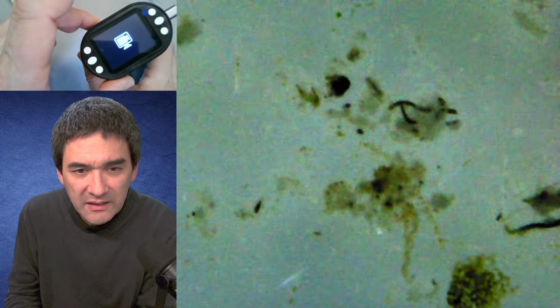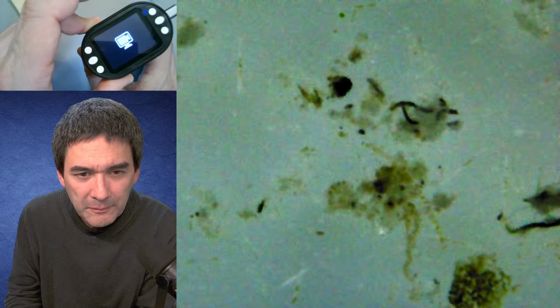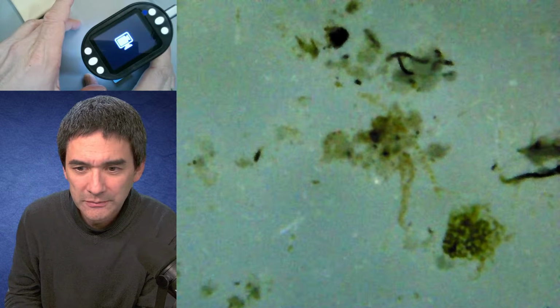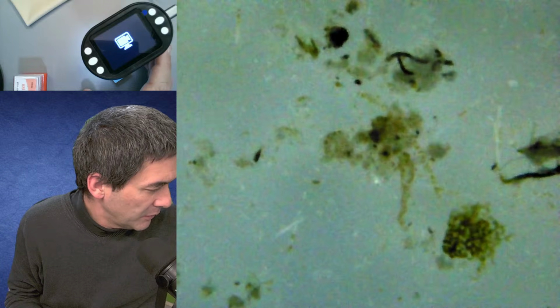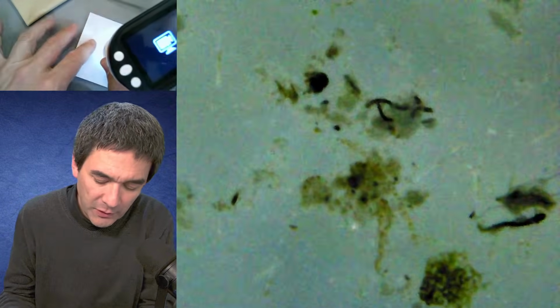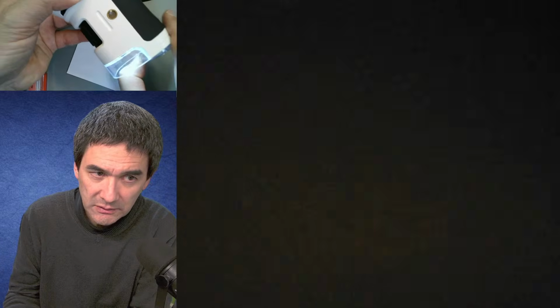But I think at least at this level, with what we have over here, it becomes very clear that we're not able to see very much. White paper, let's have a look. I don't know if white paper would actually do the trick. I would have to move out. I'm going to do the following: I'm going to take this away here, and I'm going to put it directly over it.